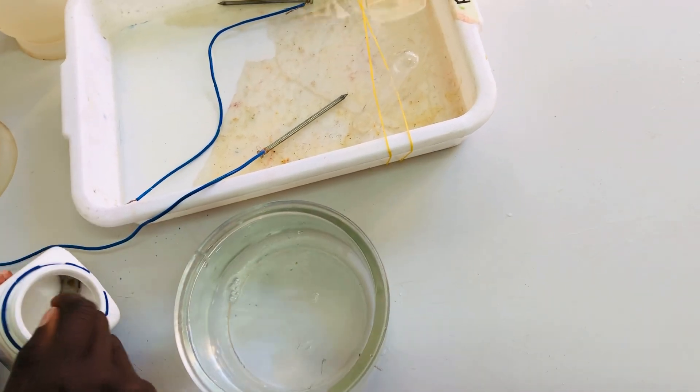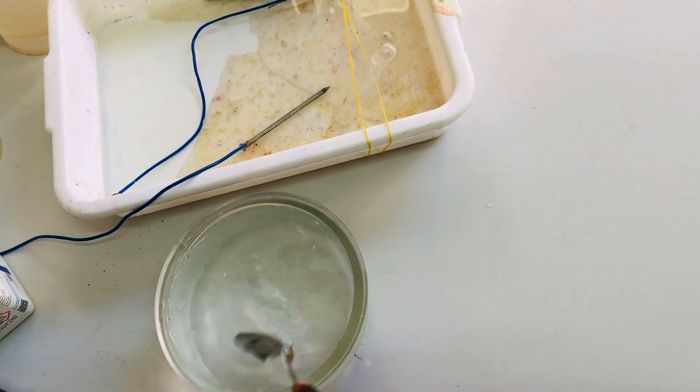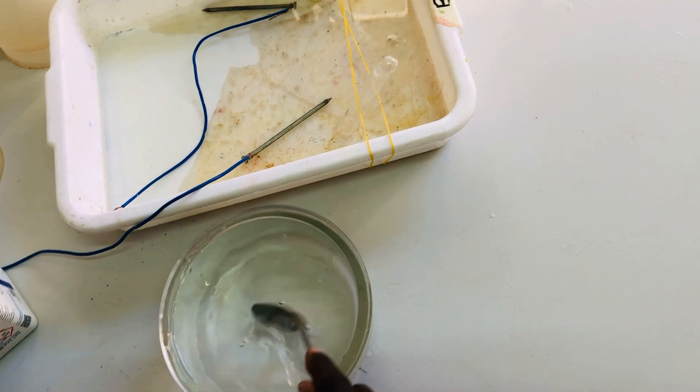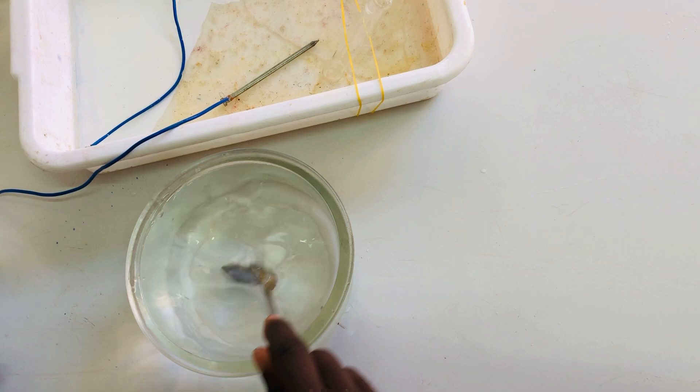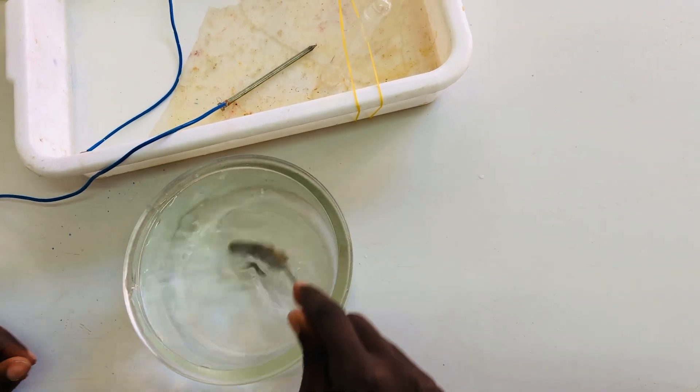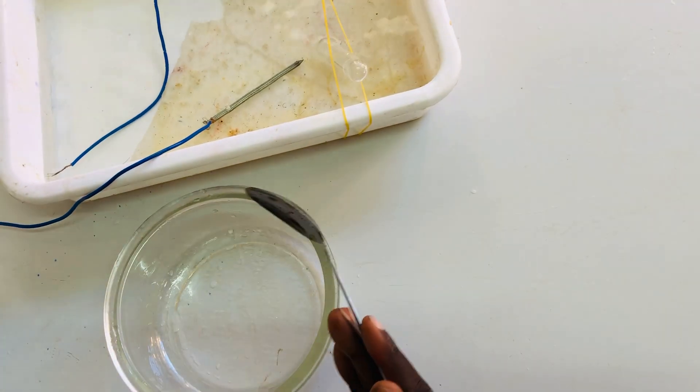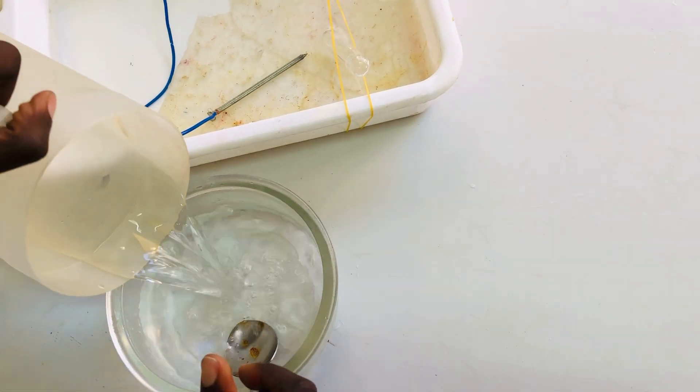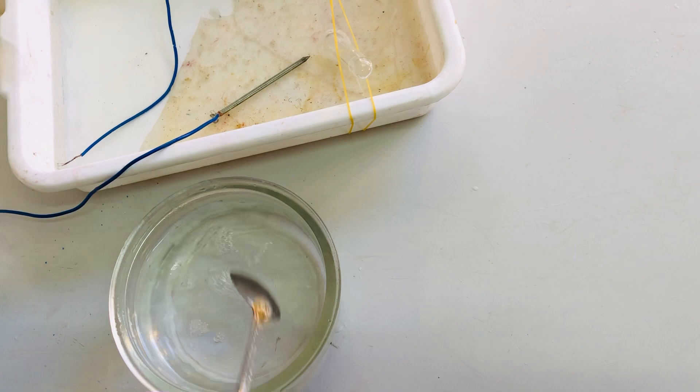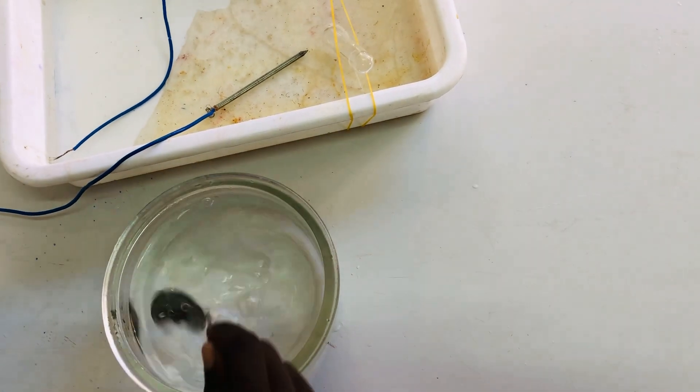Just put some salt to make water be a good conductor of current. Make sure you dissolve it, then I take another salt and dissolve it.